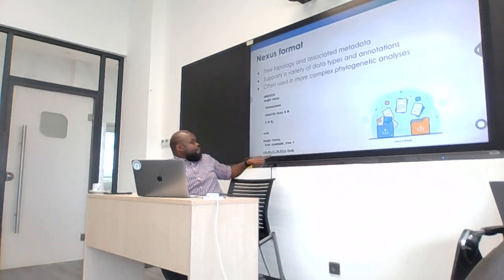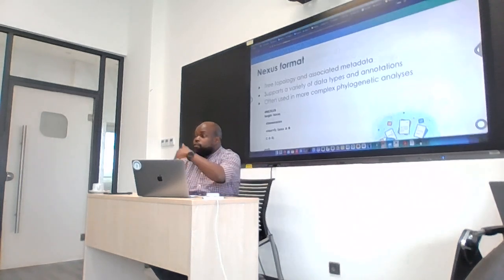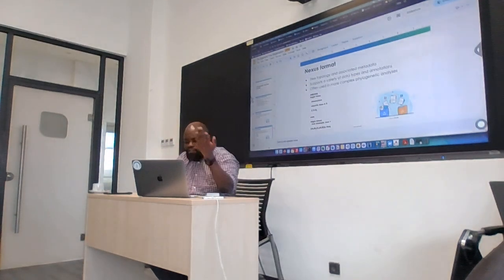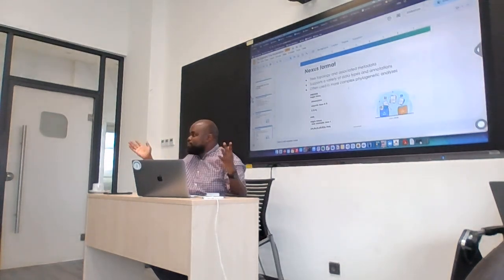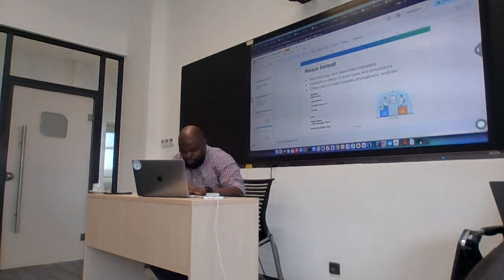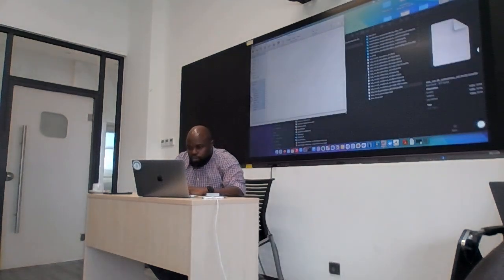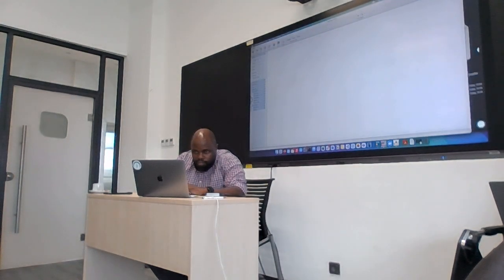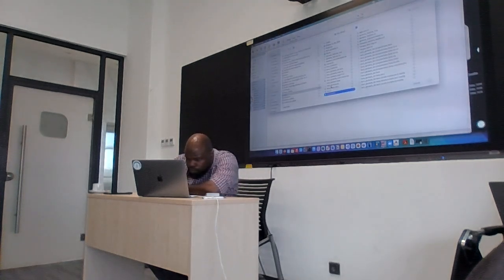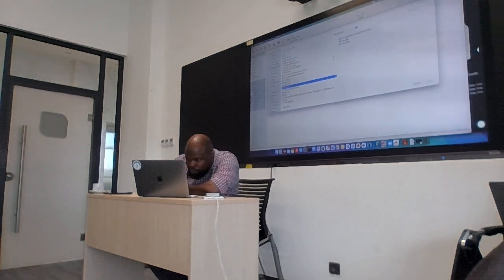Okay? And then we have end. So I know the tree we generated is Newick, right? Let's try and make it Nexus format. So don't worry about what I'm doing. Don't struggle to do what I'm doing, because you don't have FigTree at the moment. So I'm going to open this tree on FigTree. FigTree is one of the tools that you use for visualization. But we'll talk about that shortly.